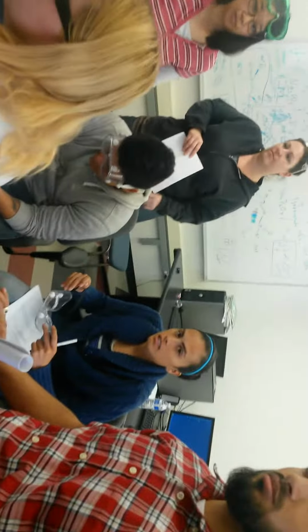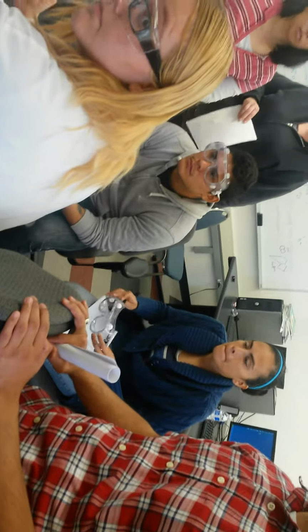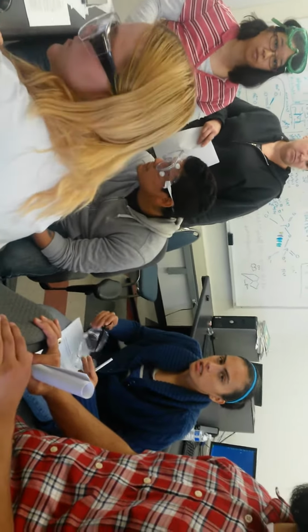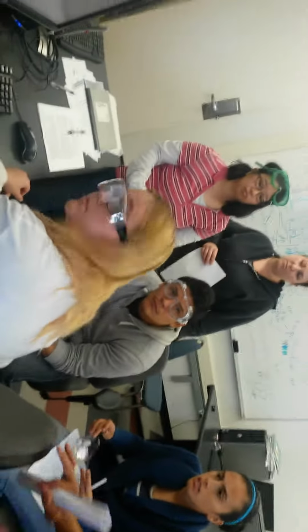Yeah, it's saved. And on this thing, going to the server, since that thing has a huge amount of space, nothing gets deleted, and it gets backed up. It is meant in case something was to happen, say there was a power outage, or the hard drive just crashed. Edgar set that up first, so it's supposed to back itself up almost every day. So every 24 hours, it backs up. Next day, it backs it up. So you're never going to lose this stuff. The data will always be there.